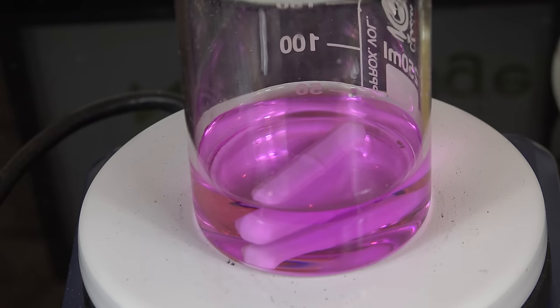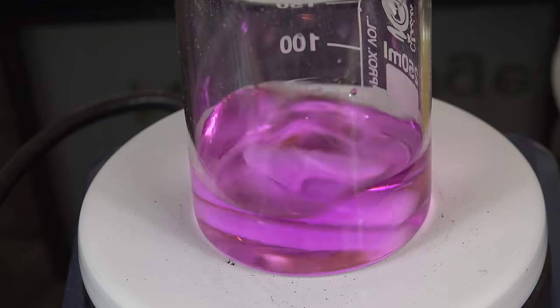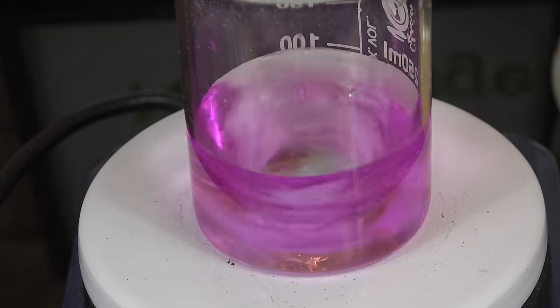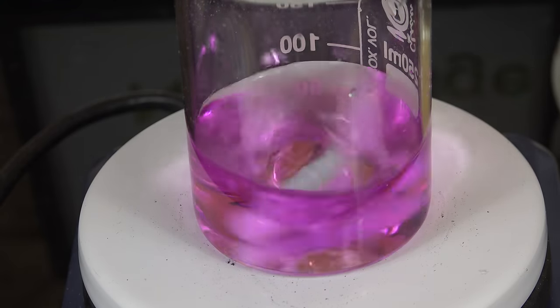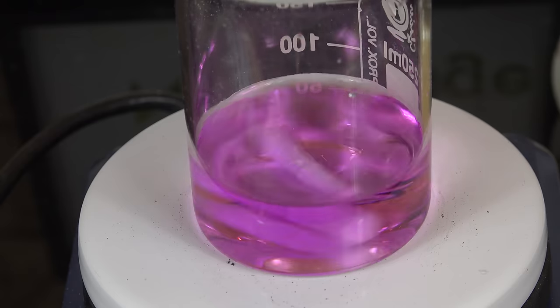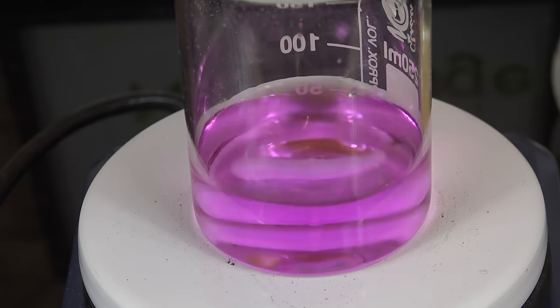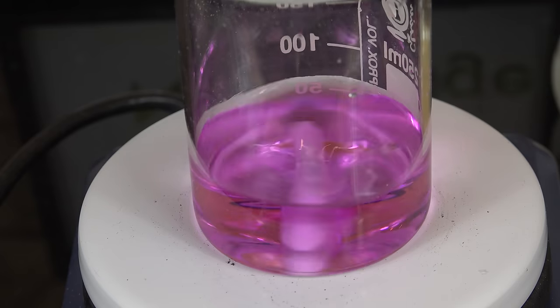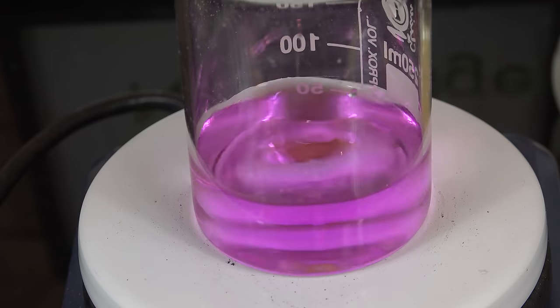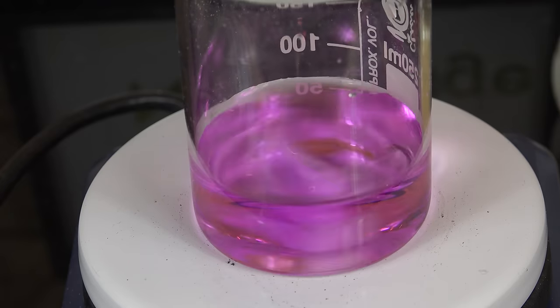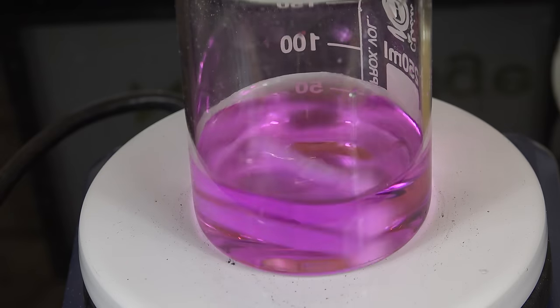You can see that we've barely started and we're already super paranoid about everything we do. That's the nature of analytical chemistry. You need to trust as little as possible and verify as much as you can. In this case we're verifying that our supporting titration mixture, sodium bisulfate solution, is not contaminated with reductive impurities. Okay let me dump that out into the waste and clean everything with deionized water.